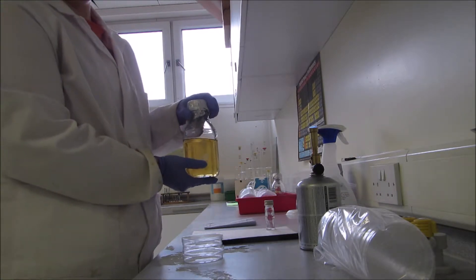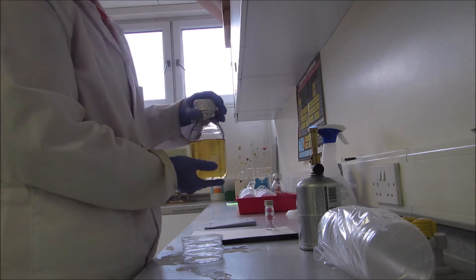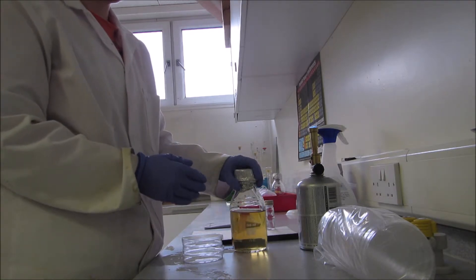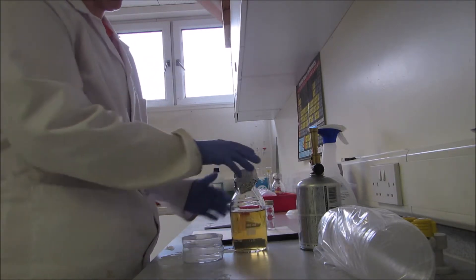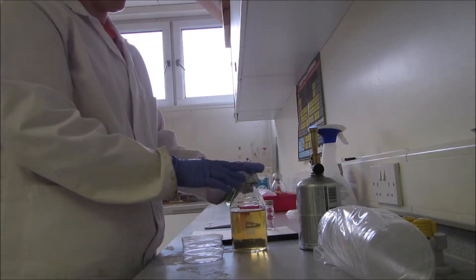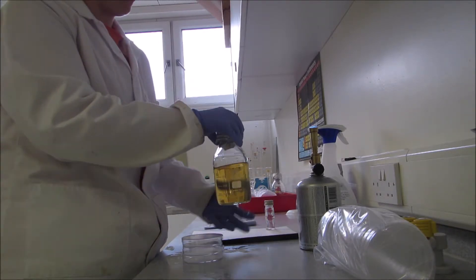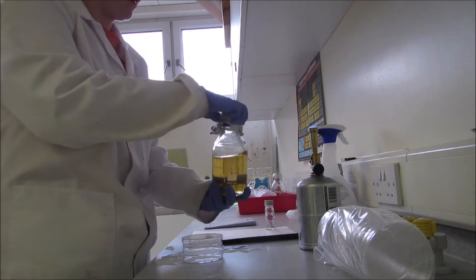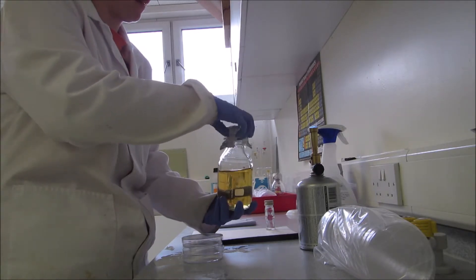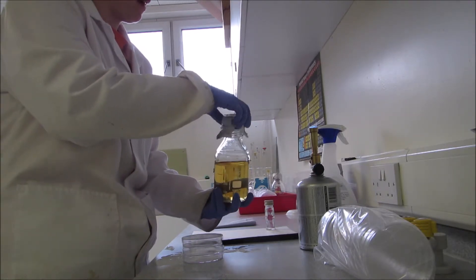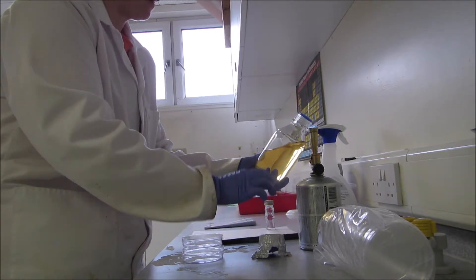Wait until your agar has cooled down a bit. You might want to put it in a water bath at about 55 degrees. Once it gets below 50 degrees it will start to solidify, so try to keep it above that. This is still fairly warm but I know it's okay for me to pour. When I come to open it, I keep it close to the flame and always flame the neck of the bottle to make sure there's no microbes.